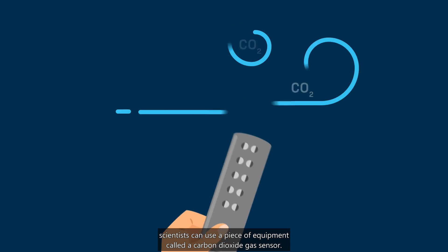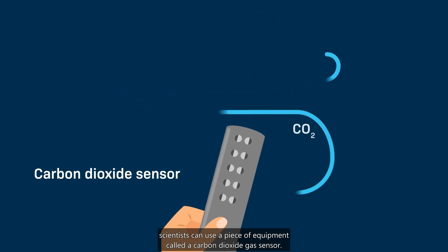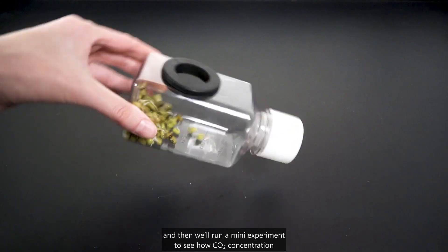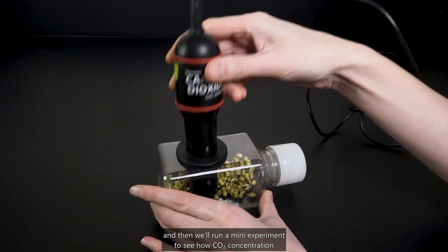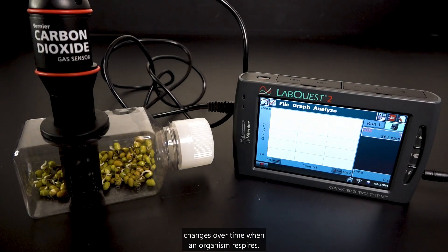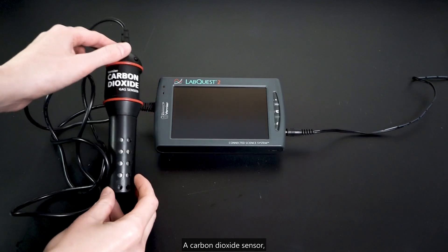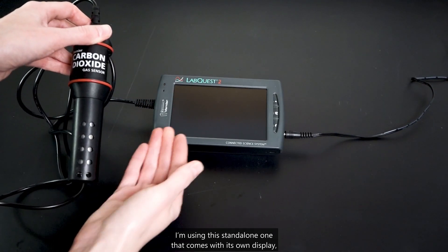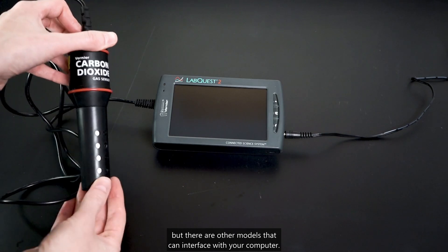To measure CO2 concentration in the air, scientists can use a piece of equipment called a carbon dioxide gas sensor. Today, we'll learn how to use this sensor in the lab, and then we'll run a mini-experiment to see how CO2 concentration changes over time when an organism respires. You'll need a carbon dioxide sensor — I'm using this standalone one that comes with its own display, but there are other models that can interface with your computer.